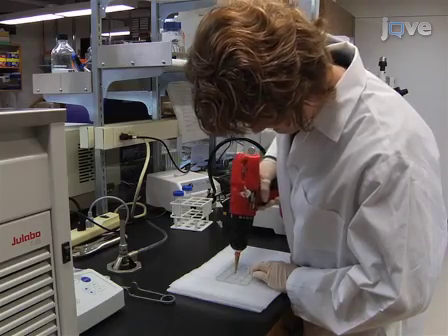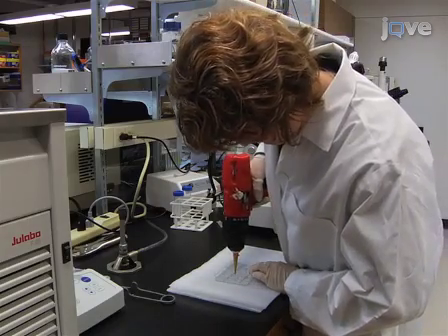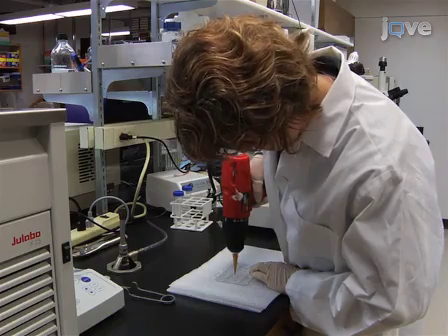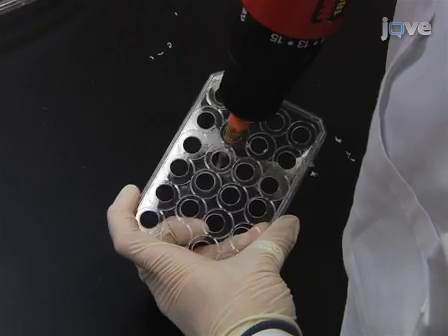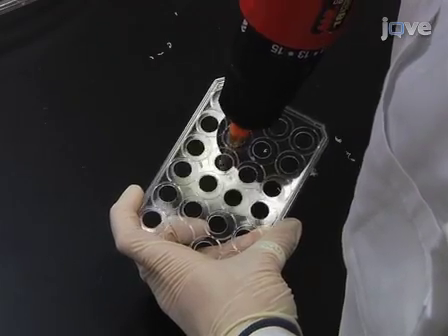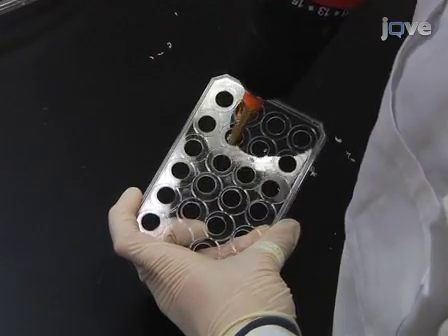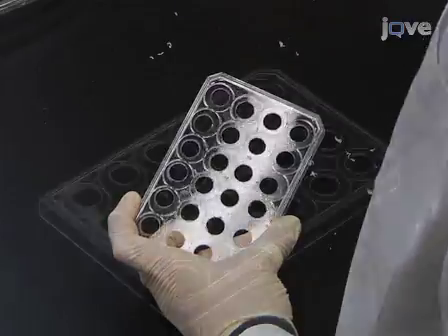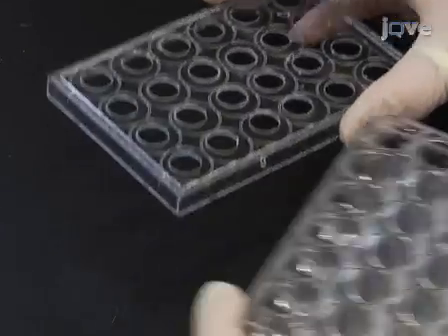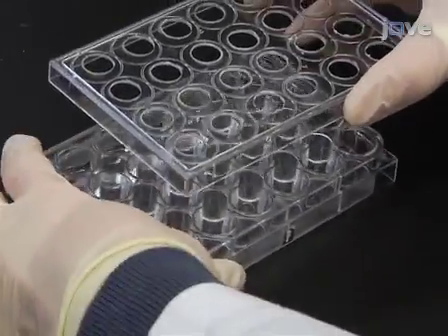Make a tray to hold the sample baskets by drilling 24 evenly spaced 12 mm holes into the lid of a 24-well plate. Each hole should be positioned directly over a well.